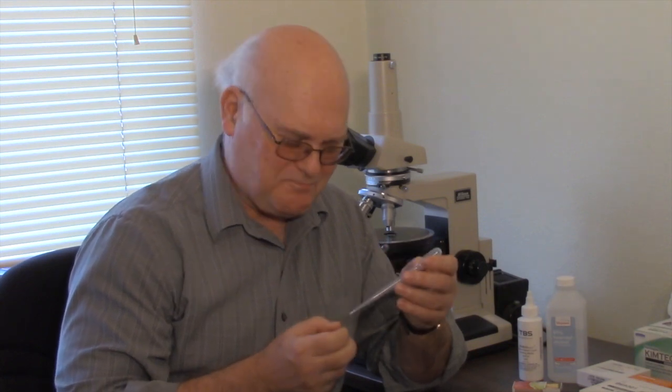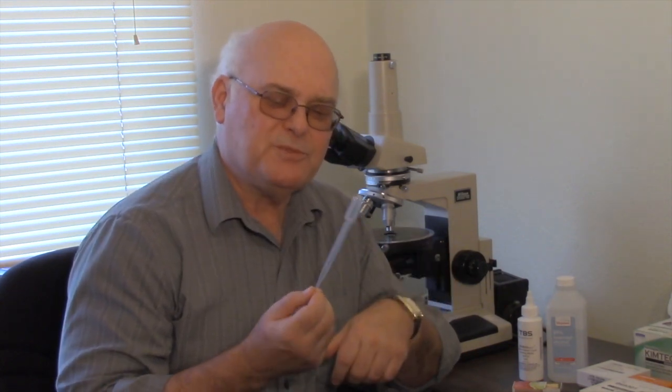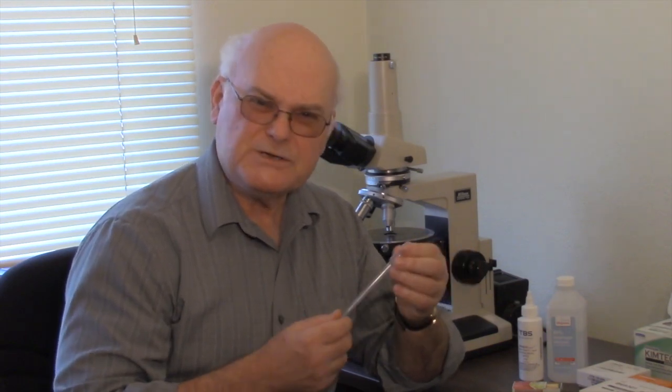One of the tools that turns out to be very useful are these little disposable pipettes with a little bulb at the end. You can get them from various websites, and we'll show you a few of those.